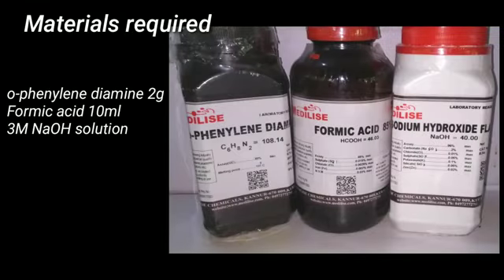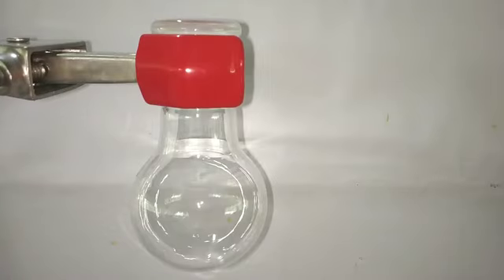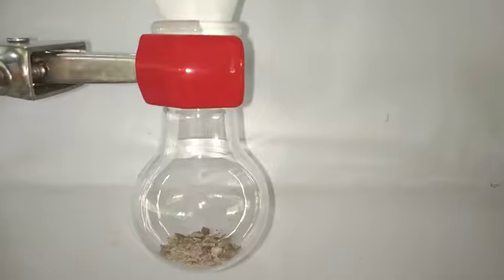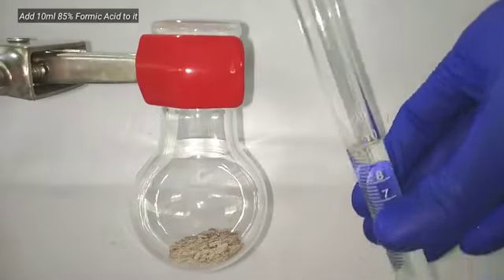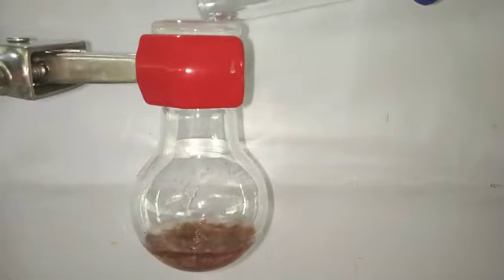Materials required for this preparation include 2 grams of orthophenylene diamine, 10 milliliters of 85% formic acid and 3 molar sodium hydroxide. Start by taking a small 50 milliliter round bottom flask and fix it on a stand. Then add the already pre-weighed 2 grams of orthophenylene diamine into it. Now add the 10 milliliters of 85% formic acid which is pre-measured in this graduated cylinder.